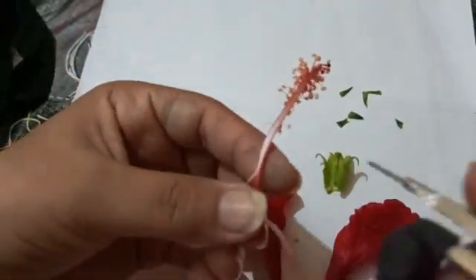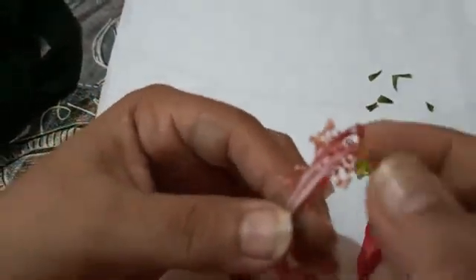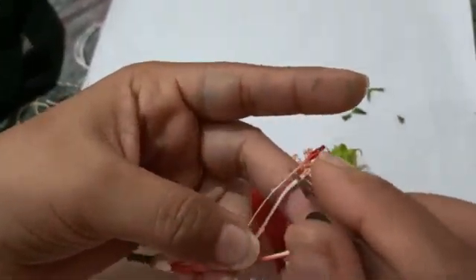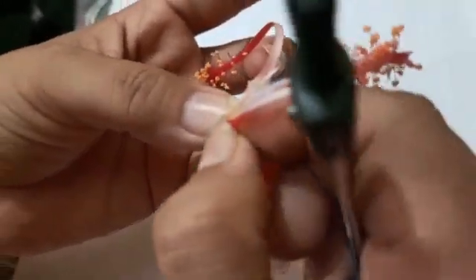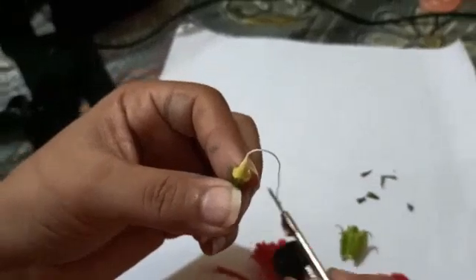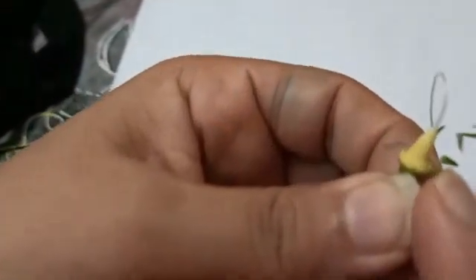All the stamens are fused from the filament to make a staminal tube around the style. You can observe the style is very thin, present inside the staminal tube. These are the stamens fused together forming the staminal tube. Now I'm going to remove this tube from the base of the ovary — you can see the ovary part from where the style is coming out.